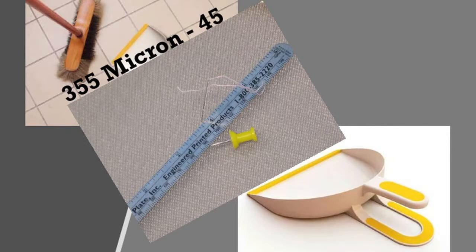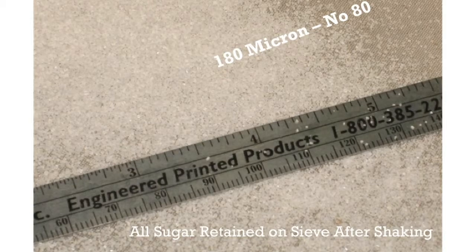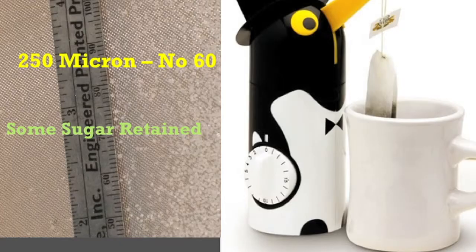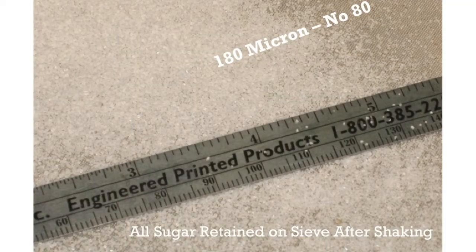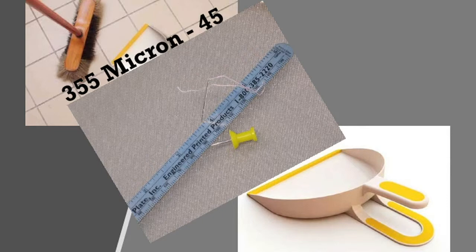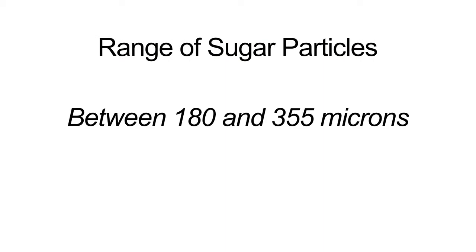Next, we test some sugar using three mesh sizes: 355 microns, 250 microns, and 180 microns. We find that all the sugar goes through the number 45 or 355 micron sieve. Some of it passed through the number 60 or 250 micron sieve, while some stayed on the surface. None of the sugar that went through the number 60 sieve passed through the number 80 sieve. These results tell us that sugar particles were all smaller than 355 microns, that some were larger than 250 microns, and that none were smaller than 180 microns — so the range was between 180 and 355 microns.